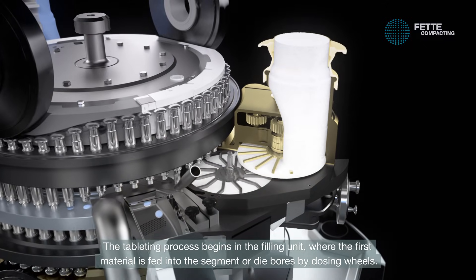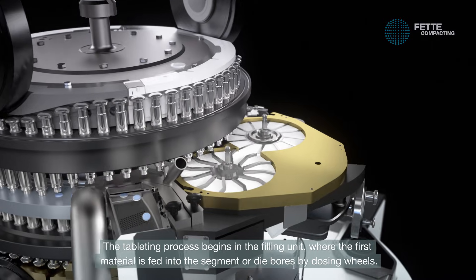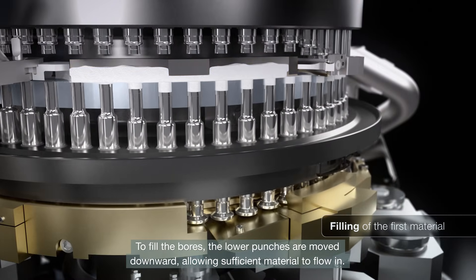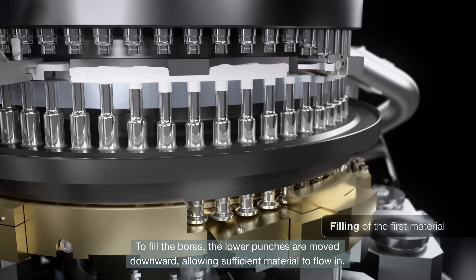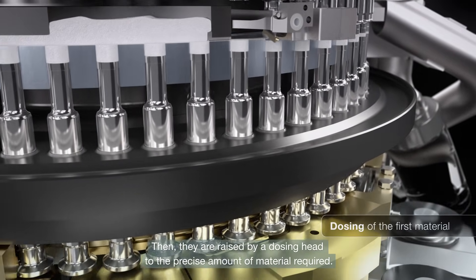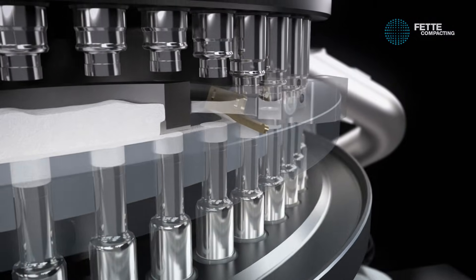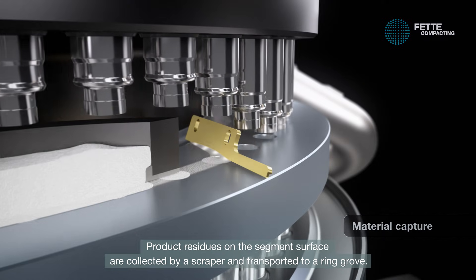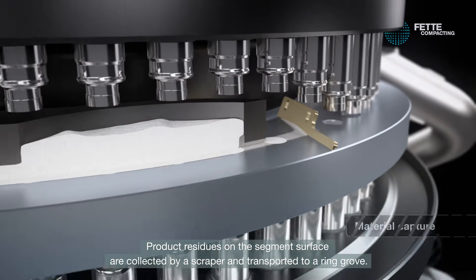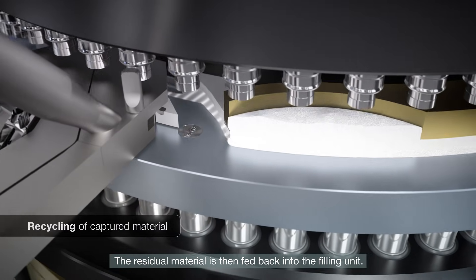The tableting process begins in the filling unit, where the first material is fed into the segment or die bores by dosing wheels. To fill the bores, the lower punches are moved downward, allowing sufficient material to flow in. Then they are raised by a dosing head to the precise amount of material required. Product residues on the segment surface are collected by a scraper and transported to a ring groove, then fed back into the filling unit.